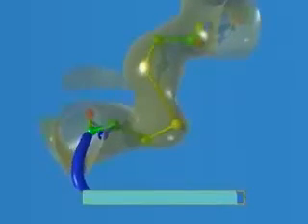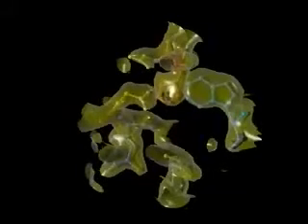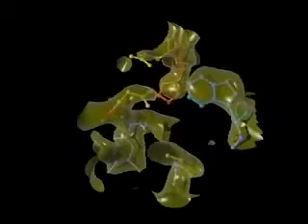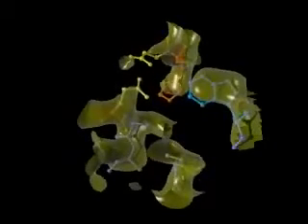The B factor for an atom gives an indication of possible movement or disorder. When the change in B factor during the experiment is examined, 3 amino acids stand out: cysteines, which engage in disulfide bonds, and the negatively charged aspartic and glutamic acids. Here we have color-coded side chains in the active site. Red and yellow indicate loss of order. Clearly, radiation damage is a highly discriminating process.